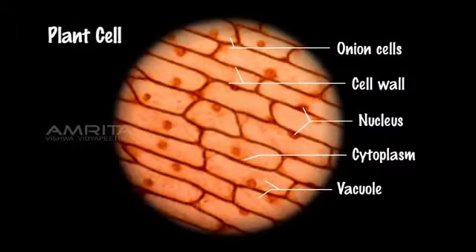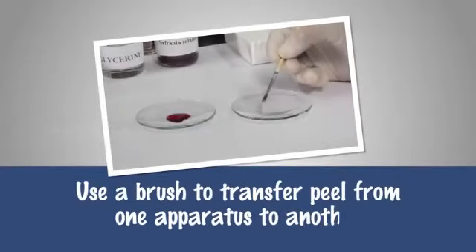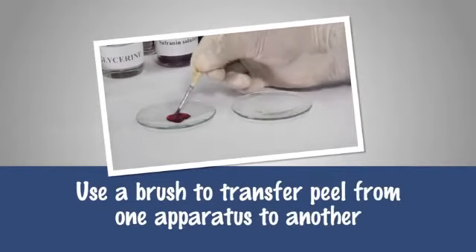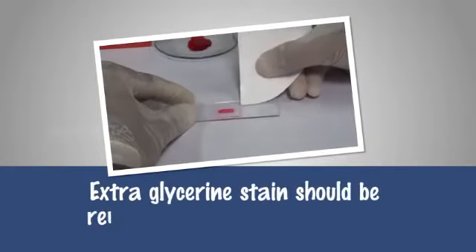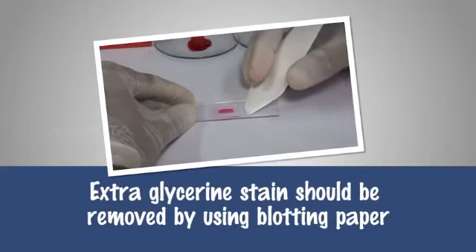Conclusion: As cell walls and large vacuoles are clearly observed in all cells, the cells in the observations are plant cells. Precaution: Use a brush to transfer peel from one apparatus to another. Staining of the peel should neither be too dark nor too light. Extra glycerine stain should be removed by using blotting paper.